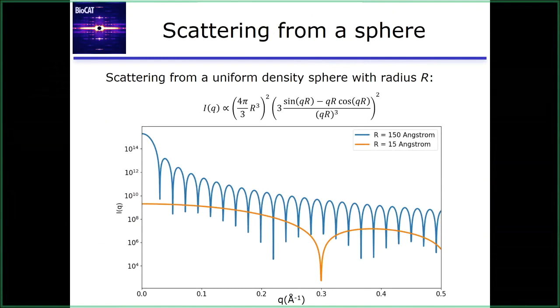But what is interesting is I plotted the scattering profiles for 2 very different sizes of spheres. Now these are the same equation, this is the same profile. All I've done is I've changed the radius. And this illustrates, I think, kind of nicely what we mean when we're talking about Q as a reciprocal space vector, as a 1/distance vector.